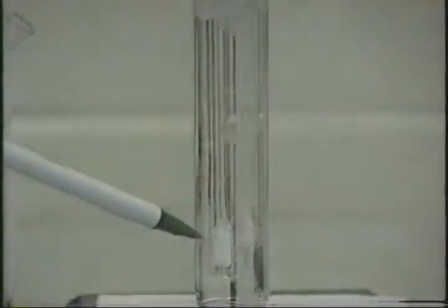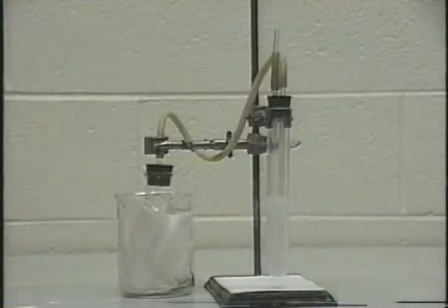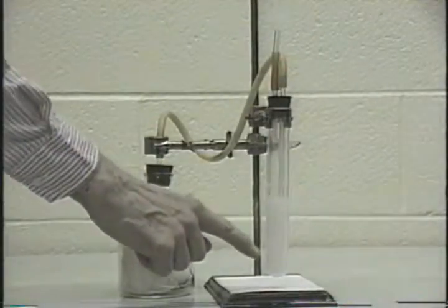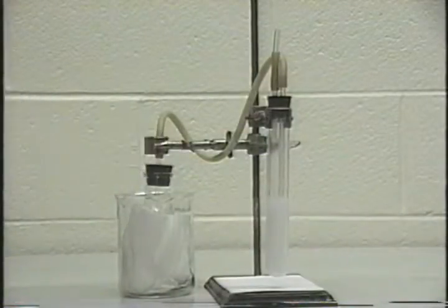After about 10 or 15 minutes, you should start seeing a buildup of sodium bicarbonate on the inside of the gas delivery tube. After about 20 or 30 minutes of bubbling, a precipitate will start to form, and this will get heavier with time. You've got to make sure that the gas inlet tube down here does not get clogged up, otherwise the stoppers will start popping.